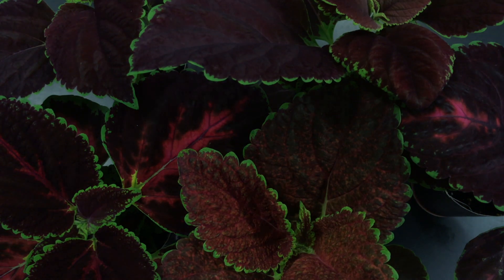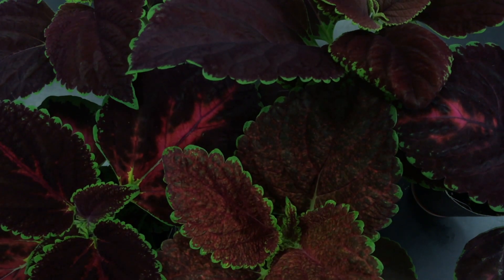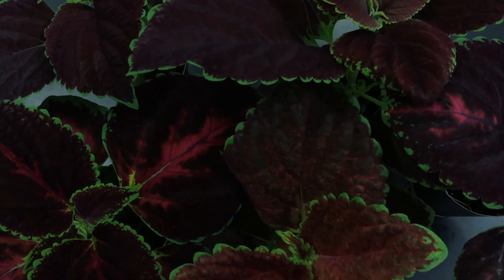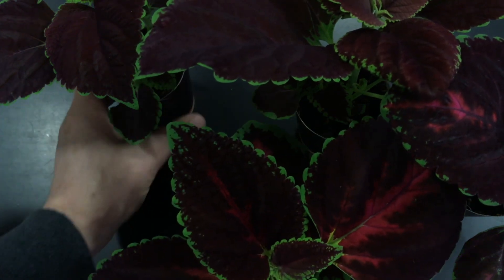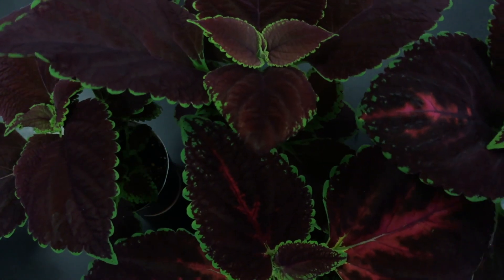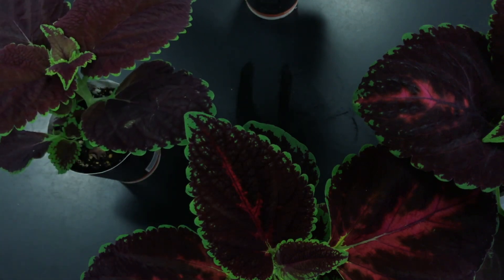In order to do that, we're going to have to bag these plants. These plants are coleus — shade-growing plants grown in our lab for this purpose. I tried to pick plants that had about the same color. This one is a little bit lighter, so it may not photosynthesize as much, and we're going to take it out. The remaining plants have about the same color and roughly the same surface area of leaves, so we're going to use four of these plants.